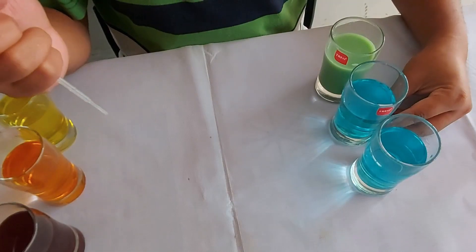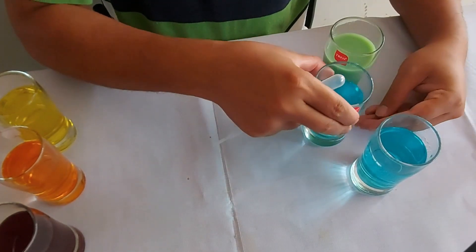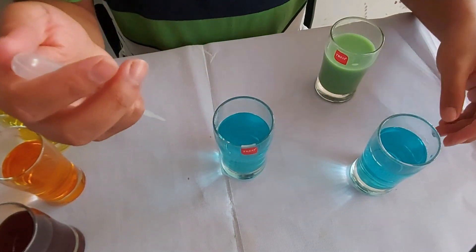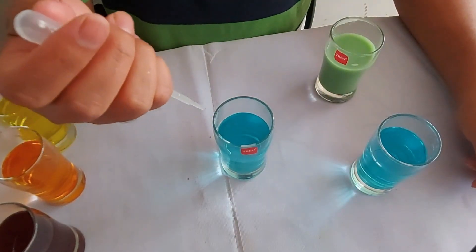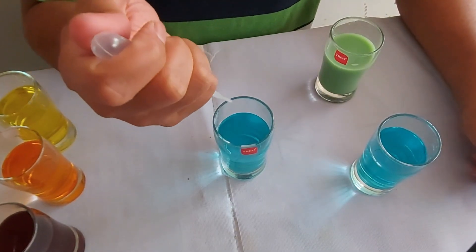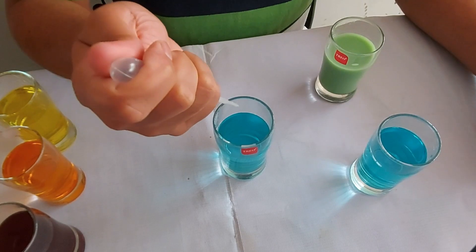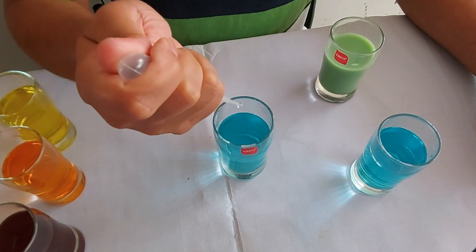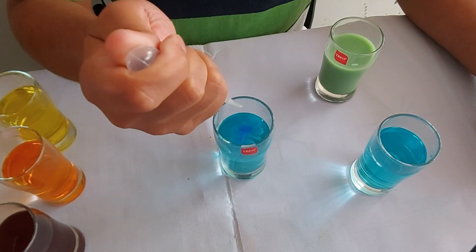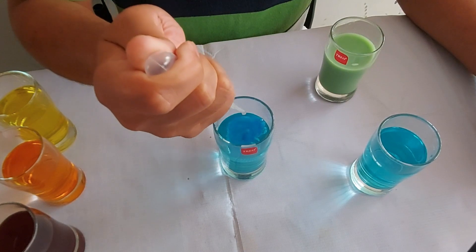Now another blue color we will turn to indigo color. We will add ammonia solution to copper sulfate solution. Let's see — you see very nicely it is coming, indigo color.